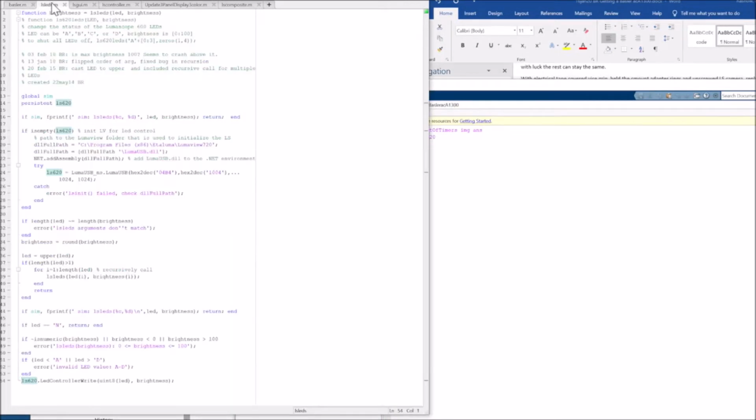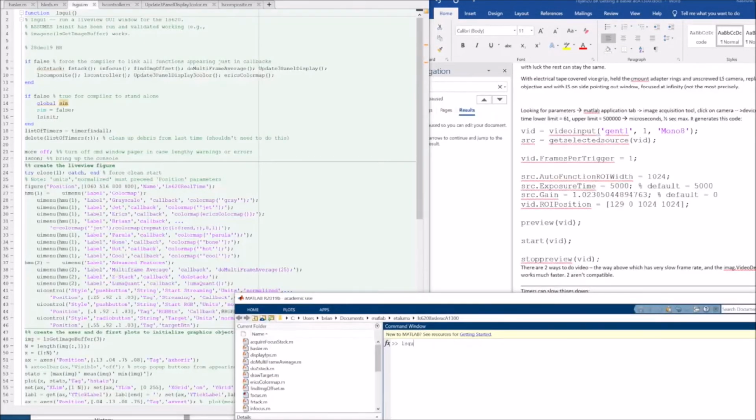The way we control the LEDs is through LSLEDs. This guy also uses a persistent variable LS620 to keep a hold of the DLL, and then it calls LED control. Right, let's fire up the GUI, LS GUI.